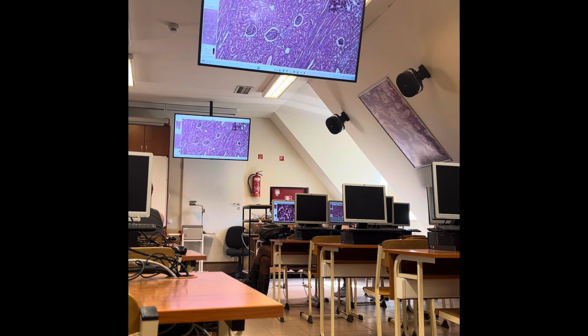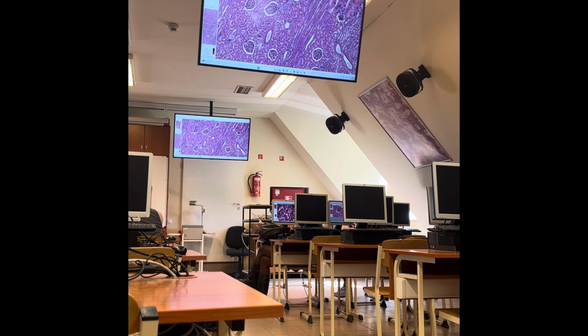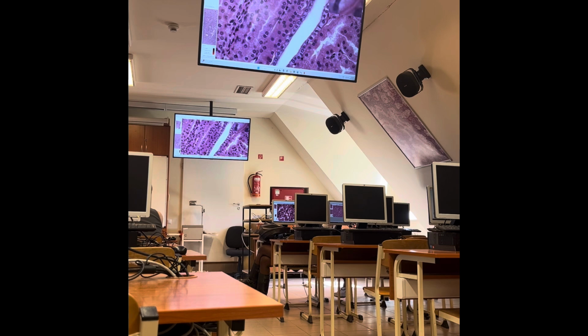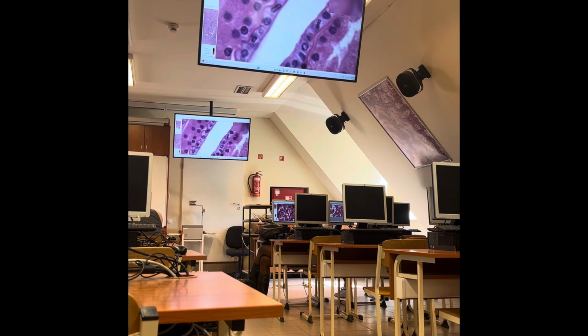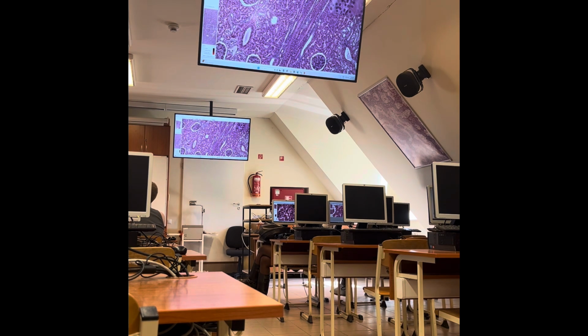Then through a short, narrow tubule, the urine is conveyed into the collecting tubules, but the collecting tubules are not part of the nephron. But collecting tubules we can find in the medullary rays, typically in peripheral location, with larger lumen and taller cuboidal cells as lining, and the cell borders are mostly visible between these cells. So these are the morphological differences here.